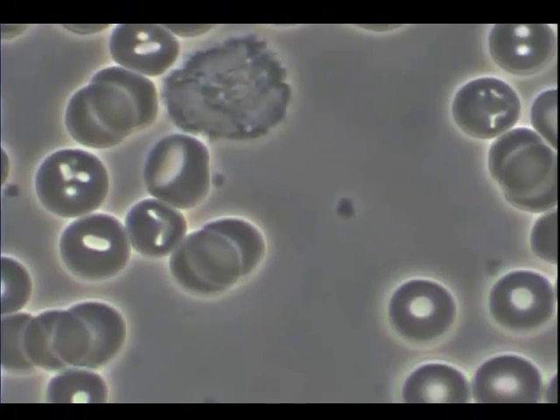Here's a view of a white blood cell or lymphocyte that appears to be reasonably healthy, although it's not streaming like a normal one would be.